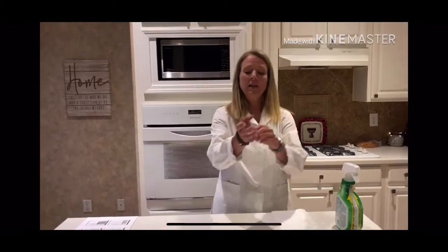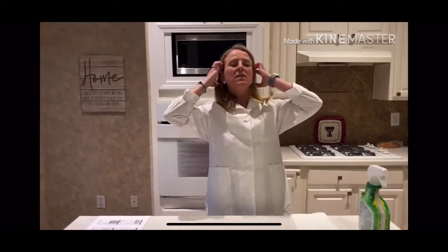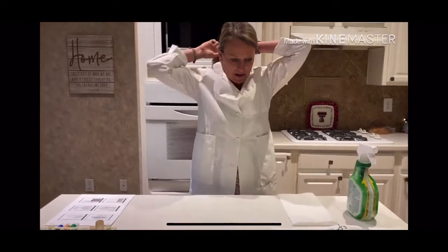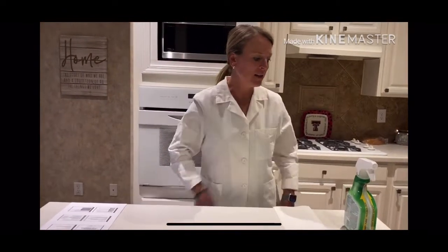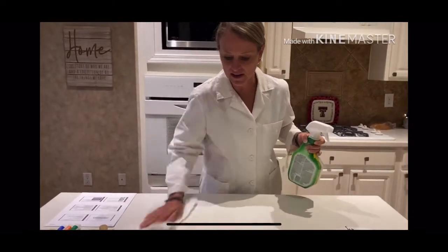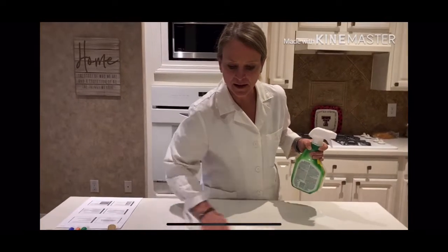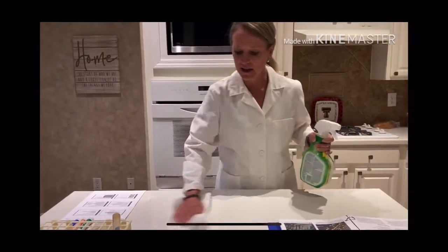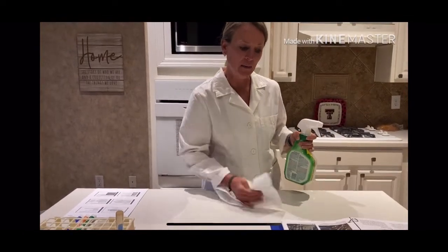So that being said, I have my rubber band. The first thing is I'm going to go ahead and pull my hair back, okay? And then I'm going to go ahead and clean off my lab bench, to make sure that it's nice and clean, again, trying to implement as much aseptic technique as possible as if you were in the lab itself.